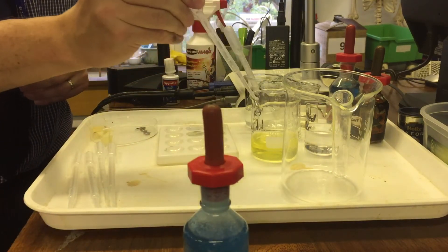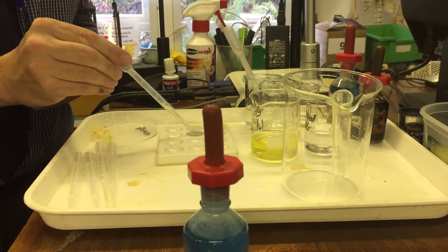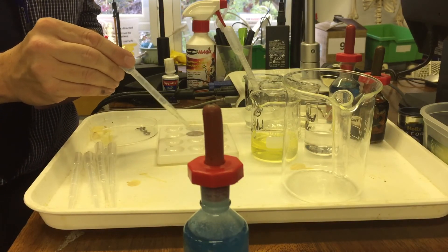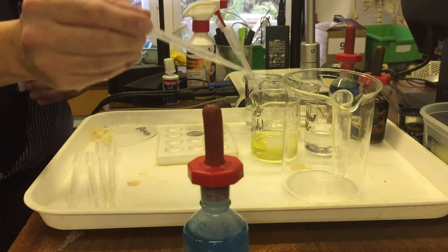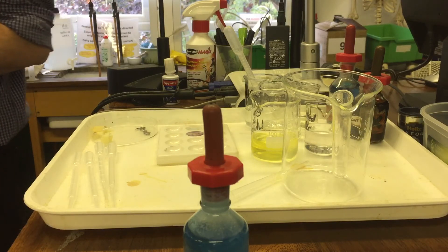And it starts developing a slightly different tint to it. Starts developing this lovely kind of lavender purple color. And that's that positive test then for protein. So that's the protein test. So we've done protein. We've done starch.